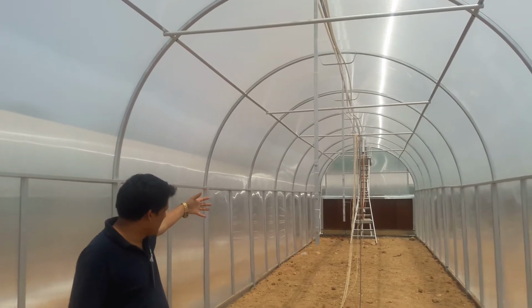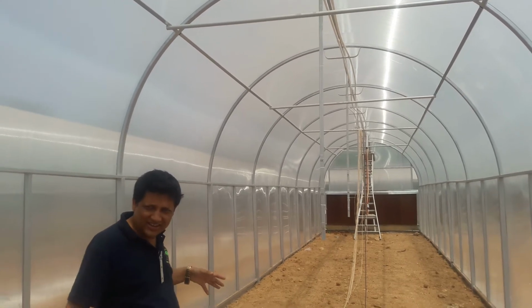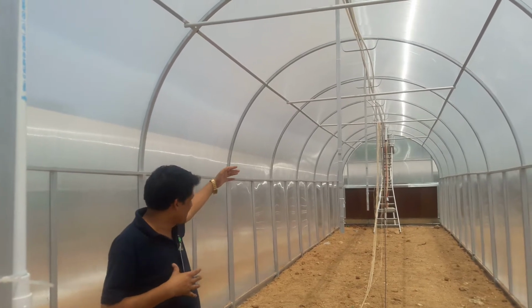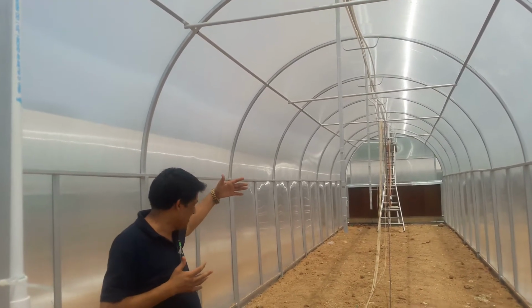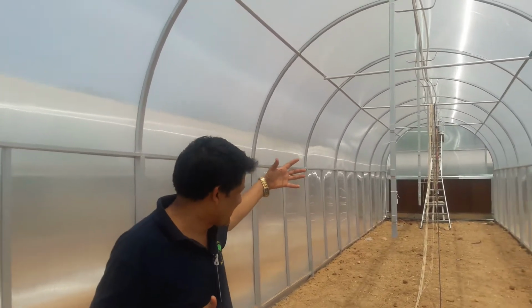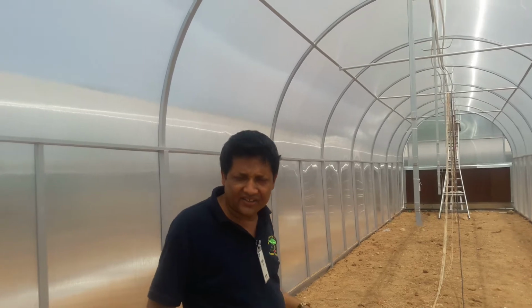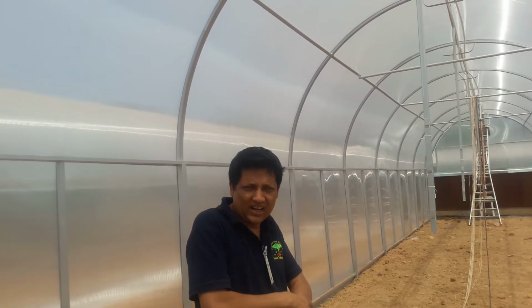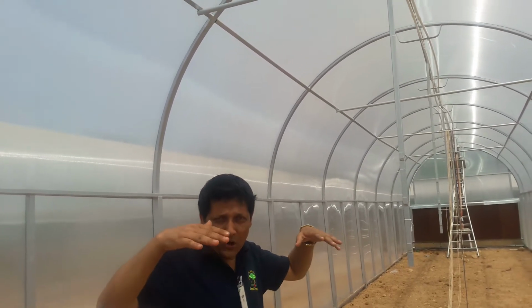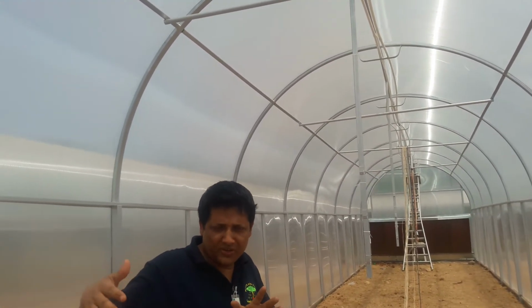Now the CO2 will be passed from one direction, the heater will be on and air will be taken out. There will be a temperature sensor and CO2 sensor mounted every 3 meters. Based on the coolant coming from the cold layer, and as air is gradually taken out from another direction, a gradient atmosphere will be created across the tunnel. This system is fully automatic, so all temperature and CO2 data will be recorded and the gradient atmosphere will be shown.